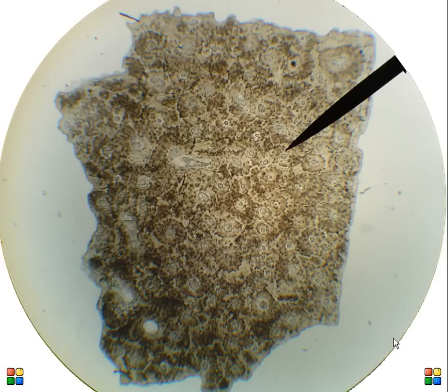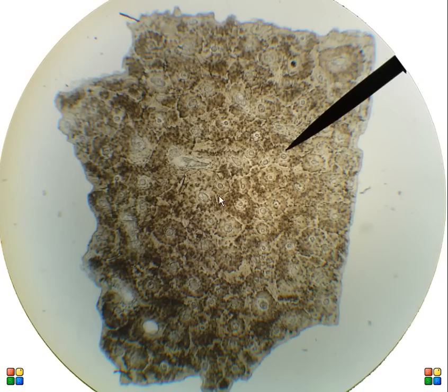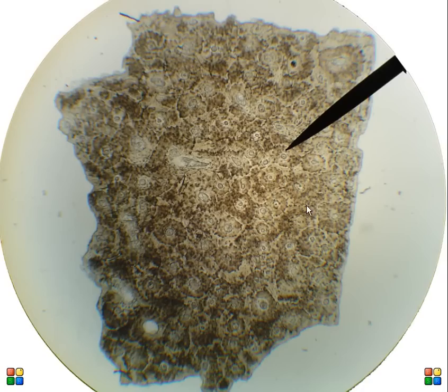Anatomy and Physiology at Glen Oaks Community College. I'm Dr. Ren Hartung. For this video we're going to do histology of bone tissue.